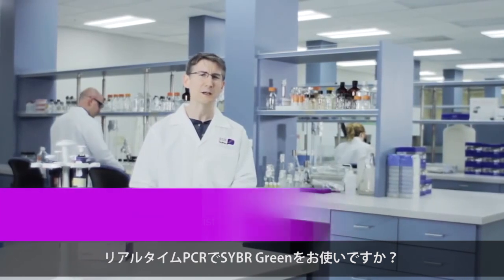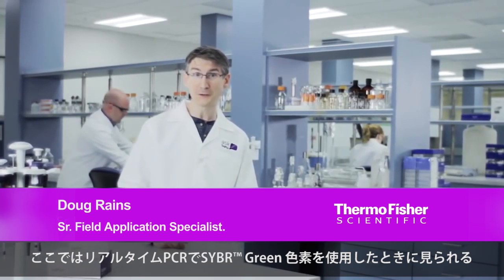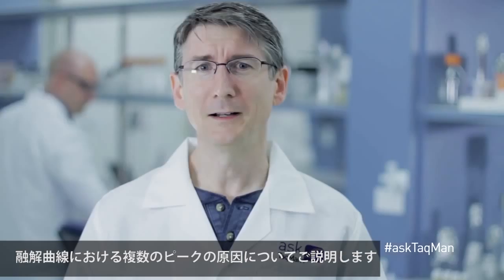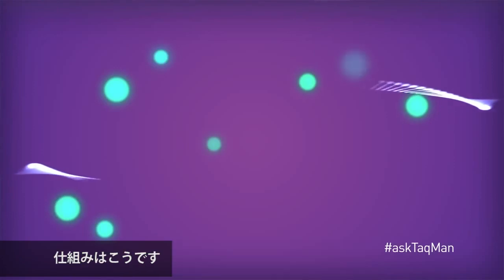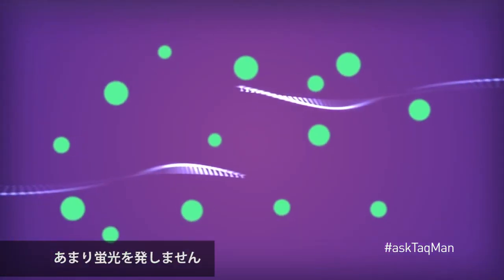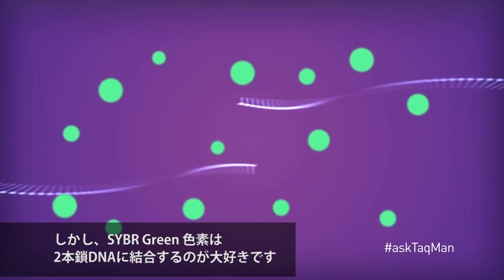Are you using SYBR Green chemistry for your real-time experiments and getting multiple peaks in your melt curve? Let's start with a little background. Unlike yours truly, SYBR Green chemistry is a free-floating dye. When SYBR Green dye is just swimming around in the tube, it doesn't give off much fluorescence, even when we zap it with the light source on a real-time instrument.